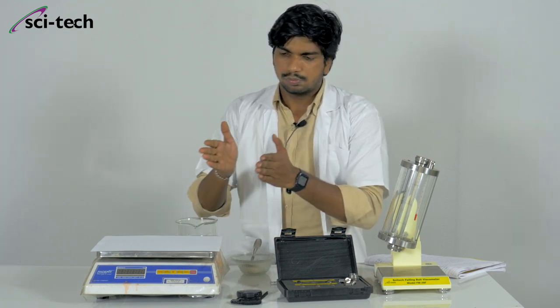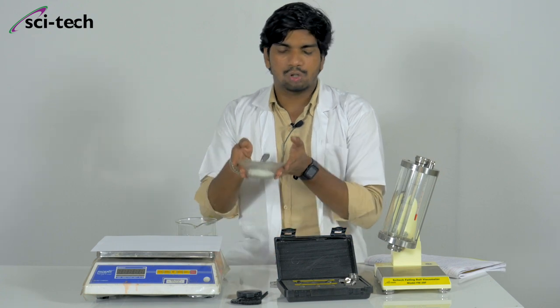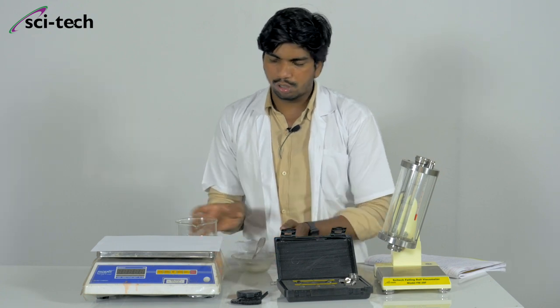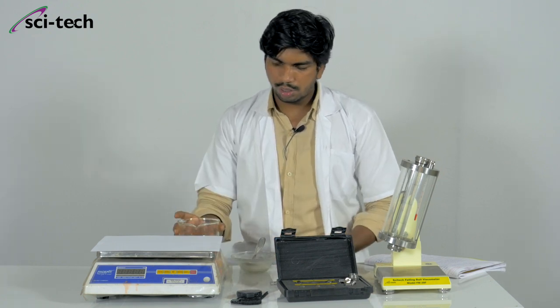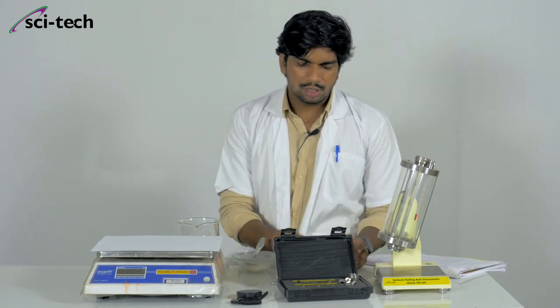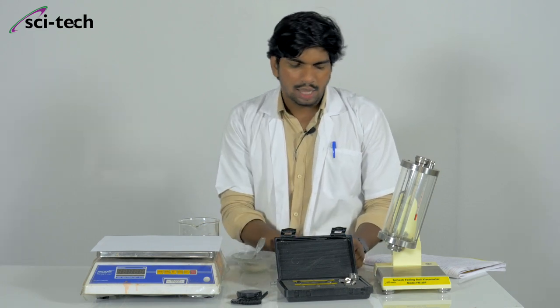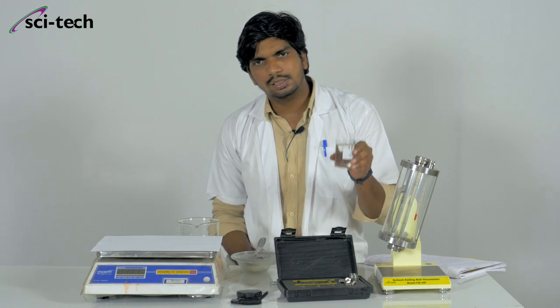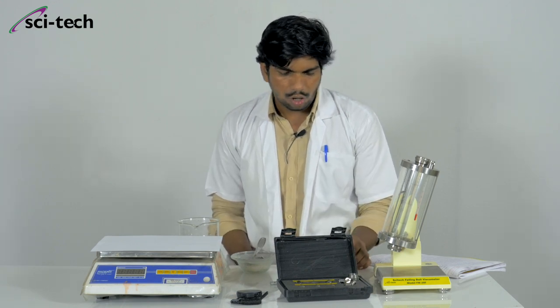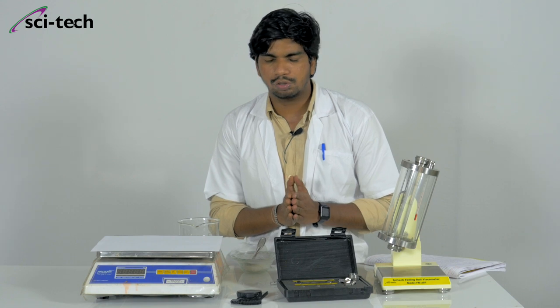We will start with making the solution. I am taking sugar as a solute and water as a solvent. Today we will make two kinds of mixture: a 40% sugar solution and a 20% sugar solution. We will study how to make these solutions.